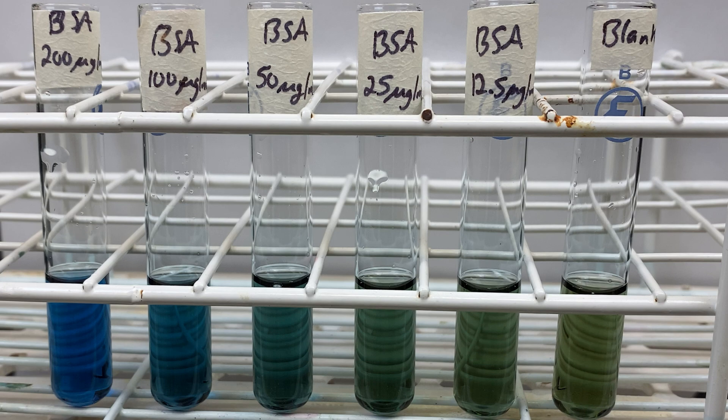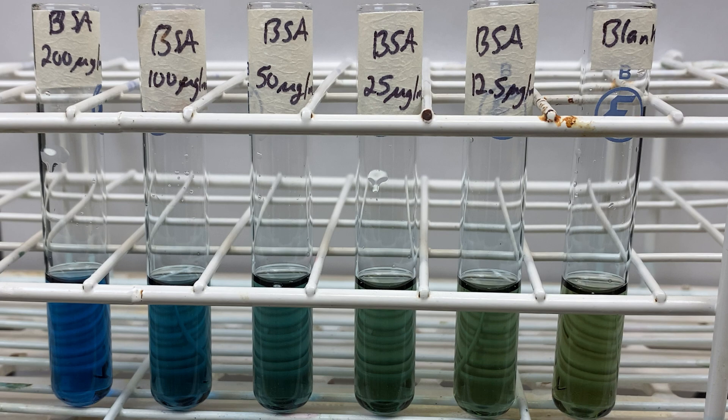Welcome to my lab. I'm Drew Collip. In today's lab, we're going to look at the Bradford assay.